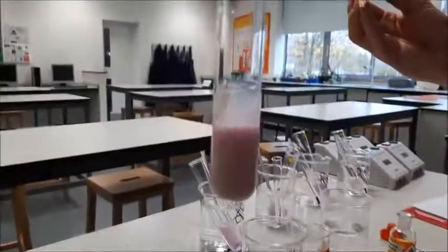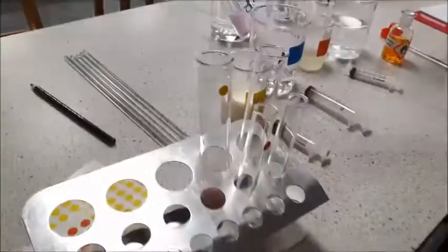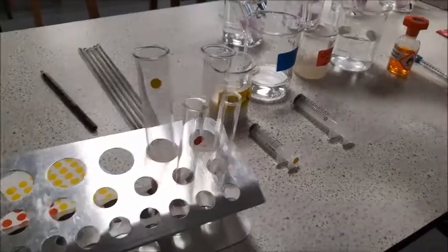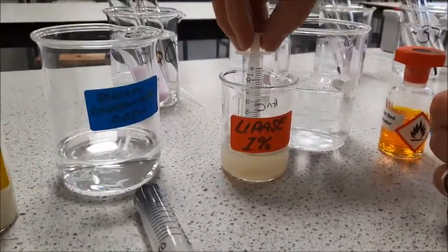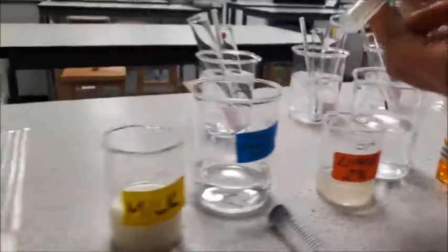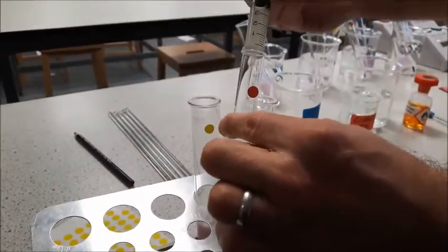We've got a lovely purple, pinky-purple colour in our milk there. Now the second thing I'm going to get is my lipase solution. For this one I'm going to need 5ml — again it's colour-coded and we're using a syringe — so that we don't get contamination or mixing before the experiment is ready to start.